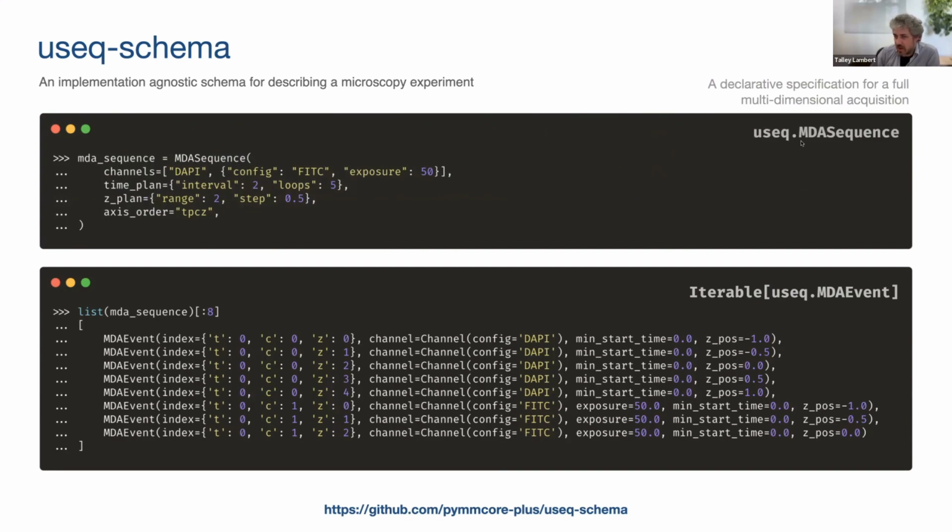A higher level object is the MDA sequence. So this is the other main object there. This is a declarative specification for a full multidimensional acquisition. So this lets you say, I've got these channels. This is how I want time. You could have multiple stage positions. Each stage position could have a custom subsequence. So there's a lot of kind of recursion, and you can make it very complex if you need to using recursion, but at its simplest, it looks something like this.